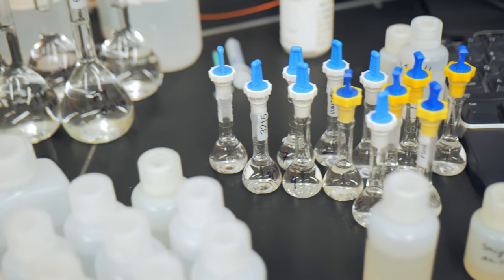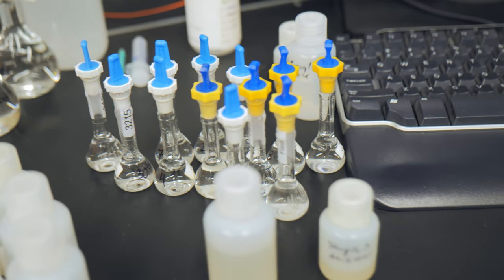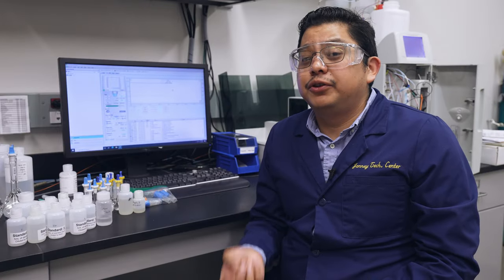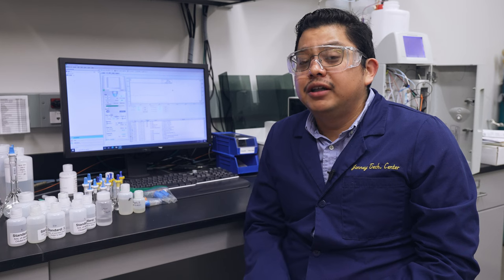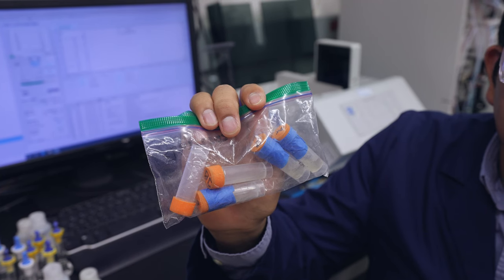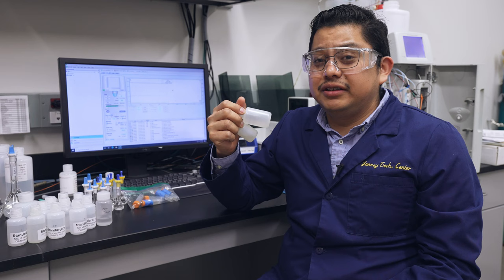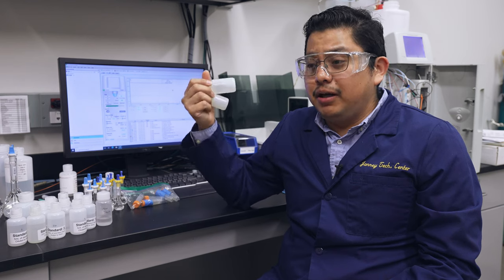We are most commonly asked to analyze water samples, often from a leak. Now let's take a look at a real-world problem. A high school experiencing leaks of water through their flooring approached us to help them solve this issue. They provided us with water originating from the leaks as well as potential sources, including tap and a nearby pool.